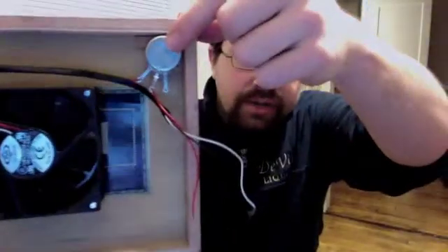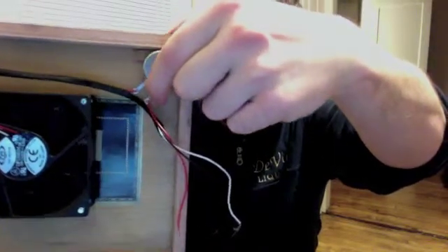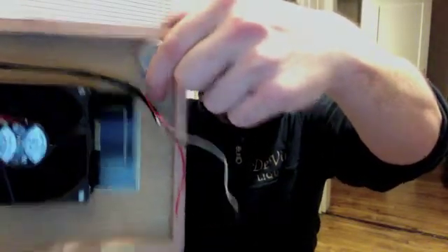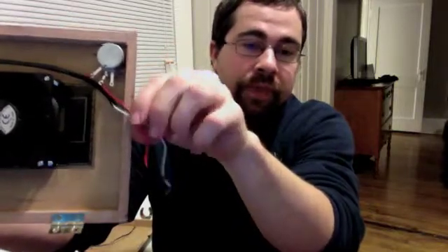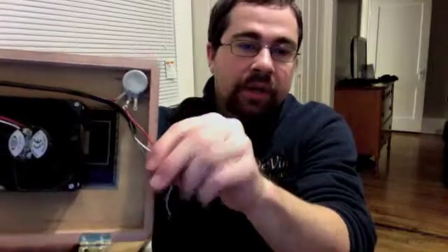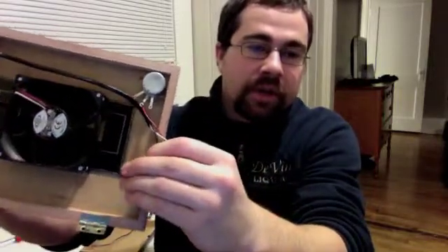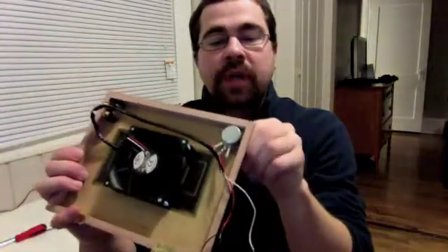You're just going to cut one cord in half and attach it to the 2 parts. As you can see, I used the red one again. Got it going from here, and then cut in half and jumps right over here, so that these are my 3 cords at the end now. And this is what's going to be attached directly to the phone charger. The black one, in this case for me, is the ground, and I'm just going to end up screwing that to this guy right there. And that's going to be the fail-safe so that it doesn't actually burn out.